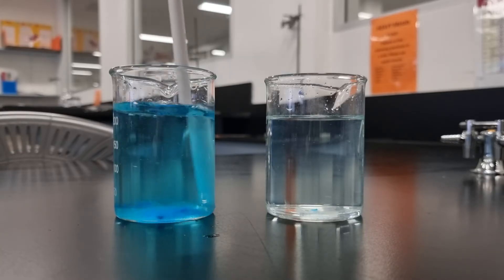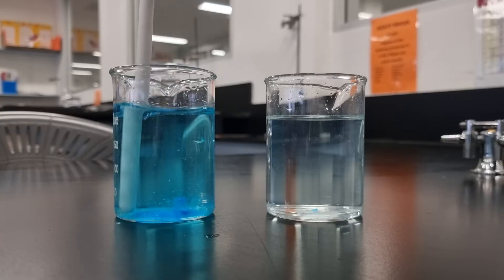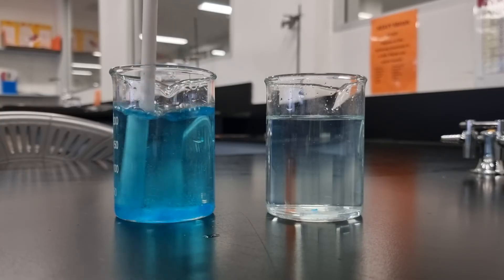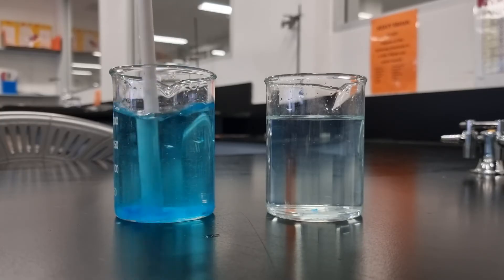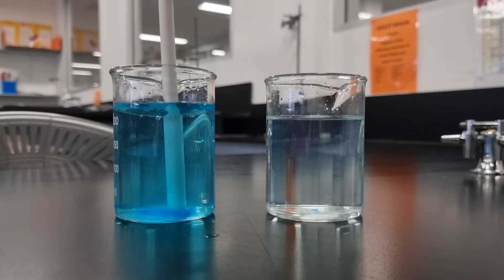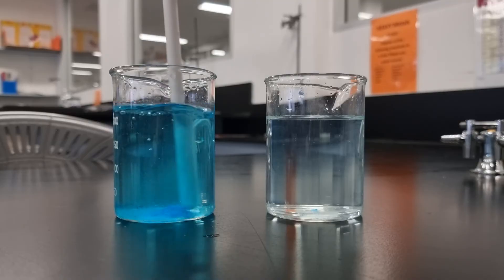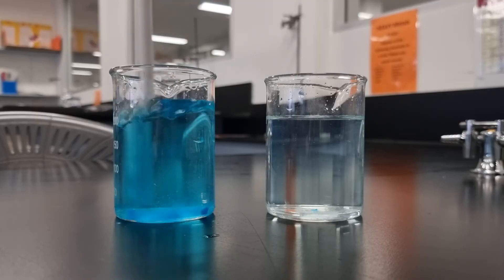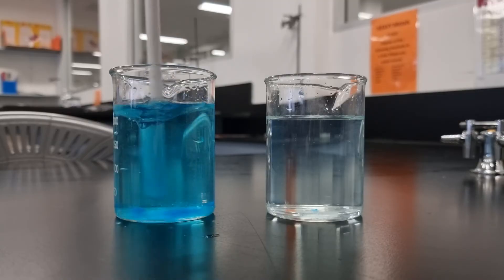In the beaker on the left I had much more copper 2 sulfate — much more got dissolved. It hasn't all dissolved; there's still some sitting on the bottom of the beaker. If I stir it for long enough it will all dissolve.